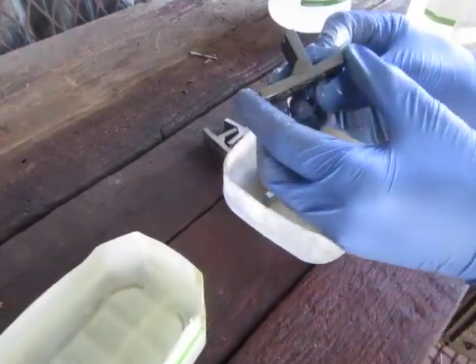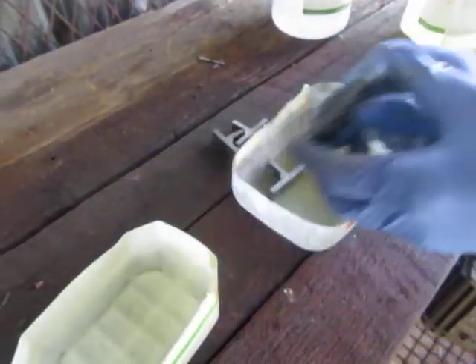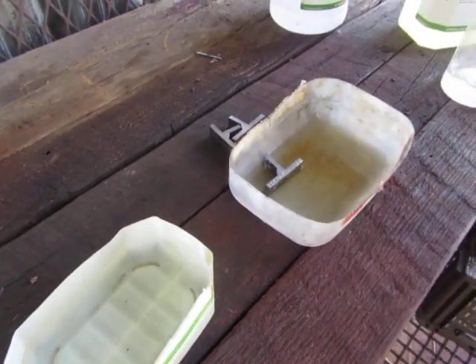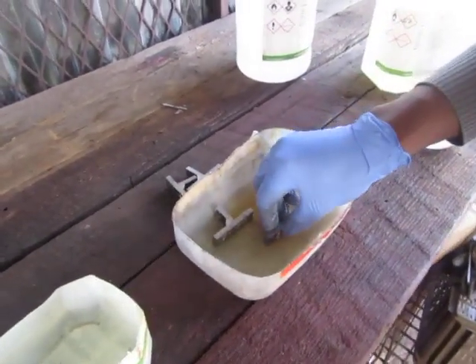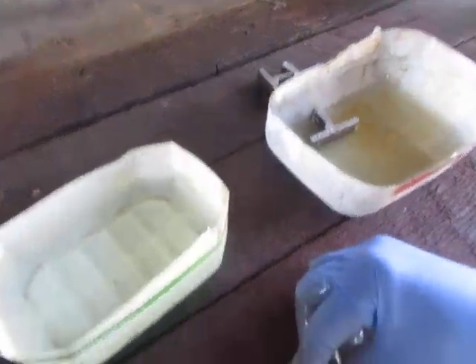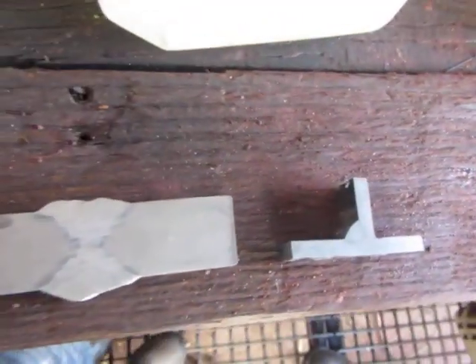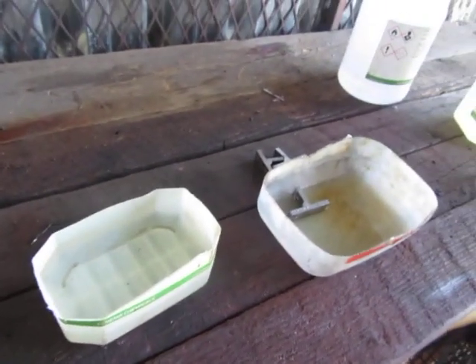Can you see how it's revealing? Can you see that? This is beautiful! Then from here, after etching, I can give it to our technician to evaluate the welds. So there we go — it was nice to share this video, and I hope you guys want more. Thank you for everything, bye bye!